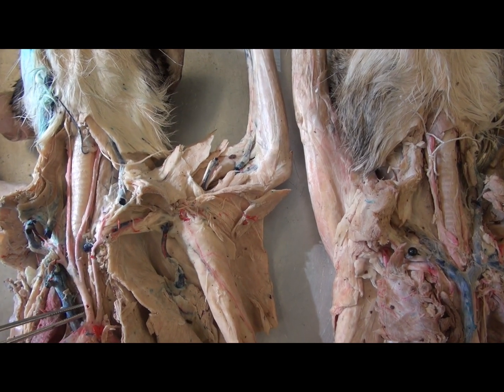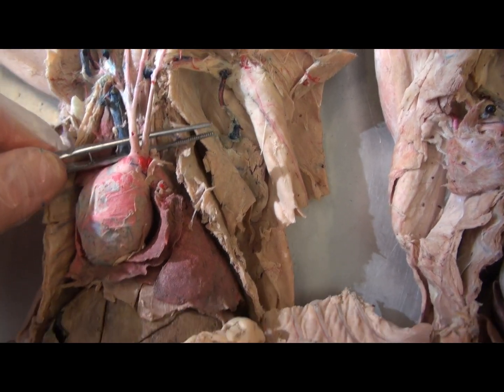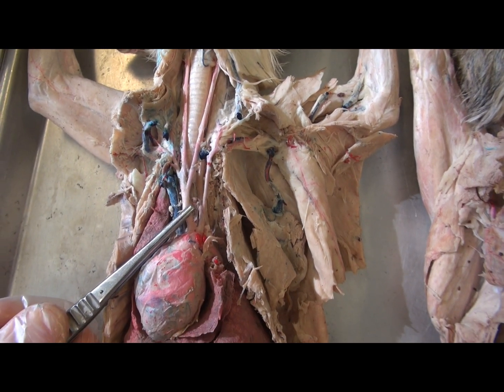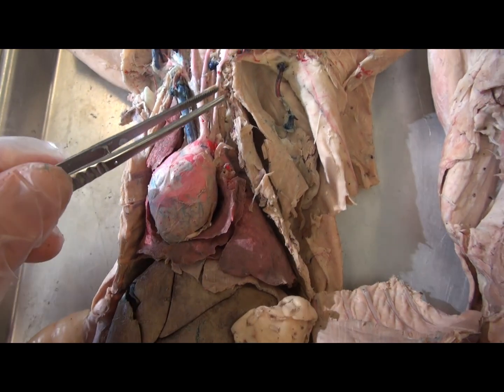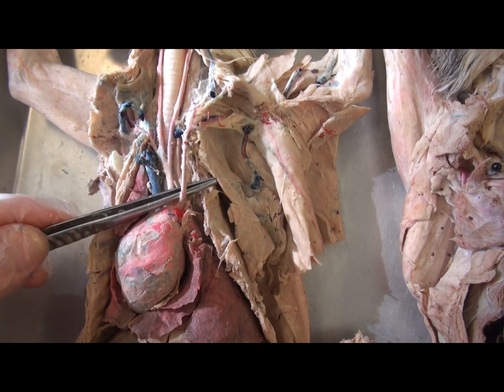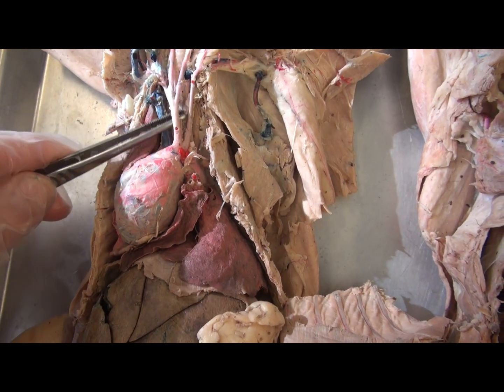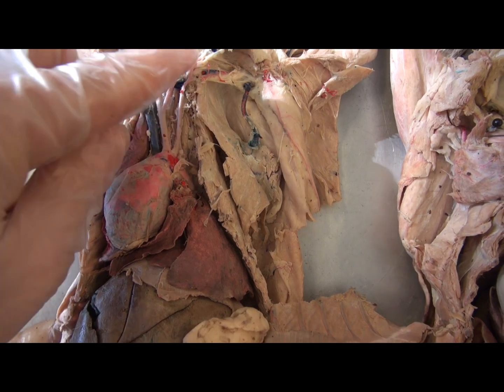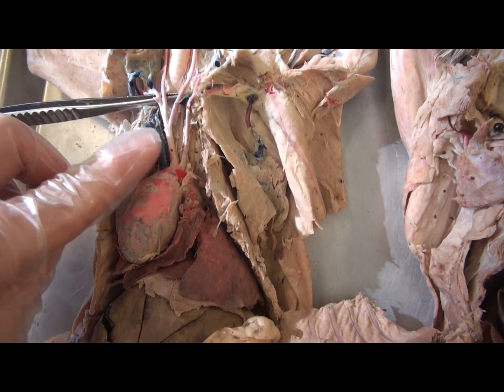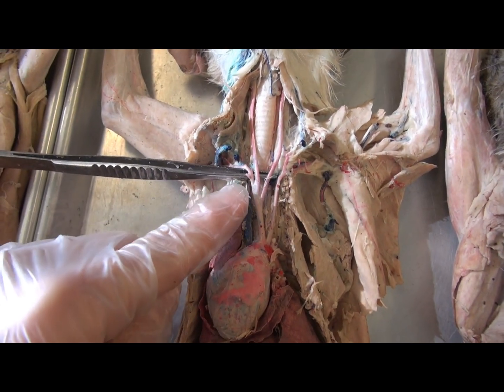Coming off the arch of the aorta, there are two arteries. This is a little different than in humans. There are similarities in that on the right there is a large brachiocephalic trunk, and the brachiocephalic trunk only exists on the right. Like humans, the left subclavian artery going toward the arm arises from the arch of the aorta. In cats, the left common carotid comes off the brachiocephalic trunk in addition to the right common carotid and the right subclavian.